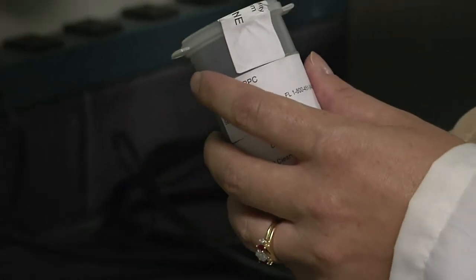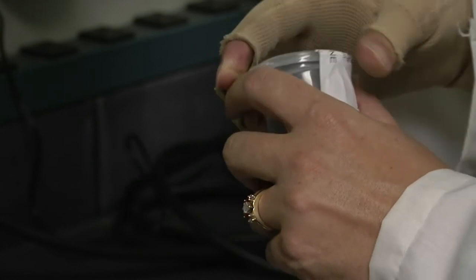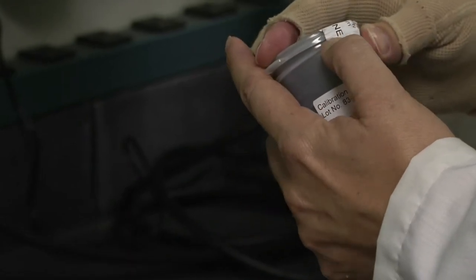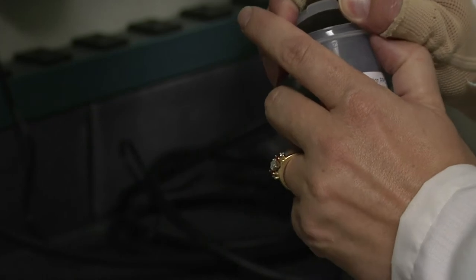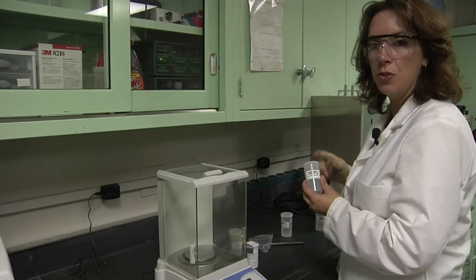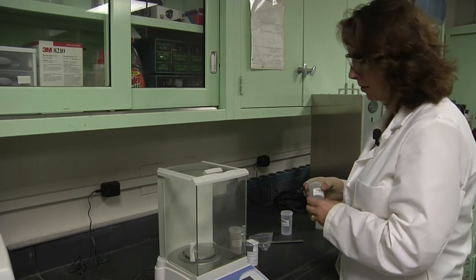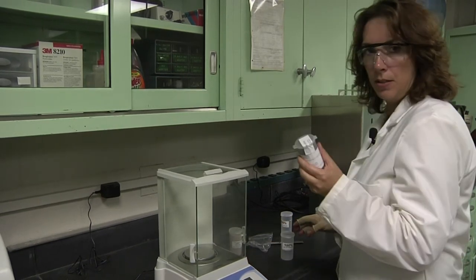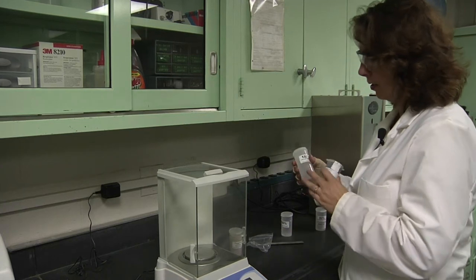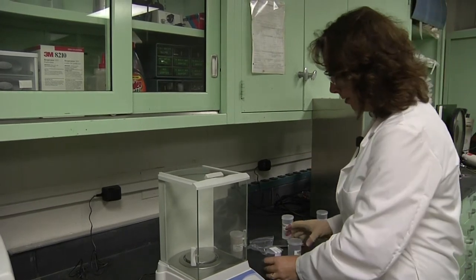There is a seal on your PPC. You want to open up the container and break that seal. To create your 100% coal dust mixture, simply add a portion of your PPC into this container.